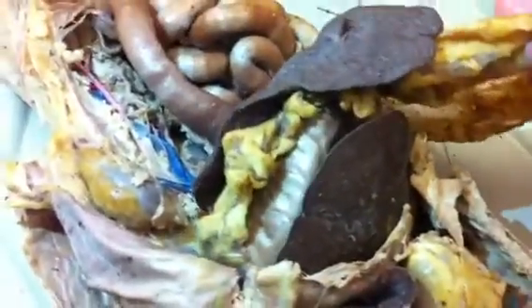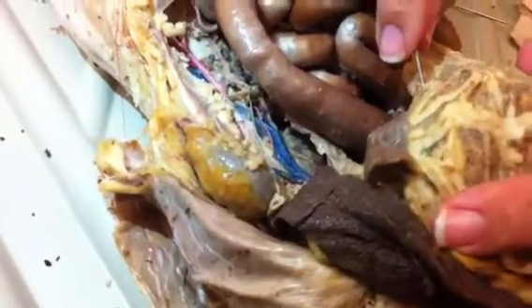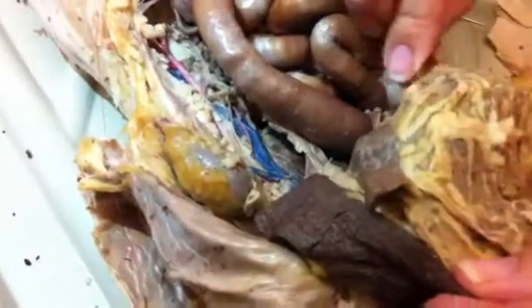Sometimes you can see a gallbladder, a liver, a nice big stomach, much bigger than your cat over there. Attached to the omentum is the spleen. She has a big spleen. What's this guy right here? Oh, that little thing? That's the pancreas. It sits right underneath the stomach, and it's connected to the omentum along with the spleen. They kind of free float there. The big thing is, if you look at the pancreas, it attaches. She's got a big one.